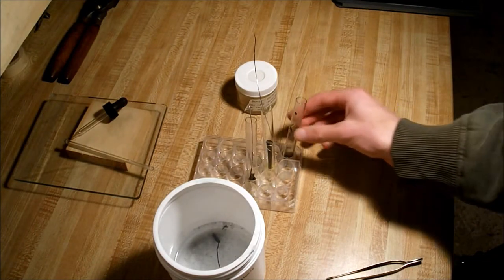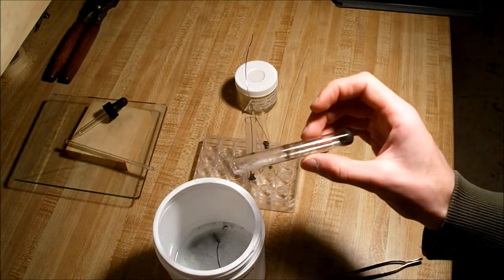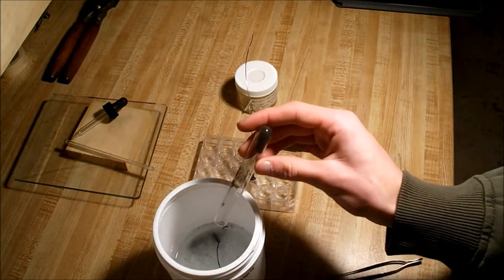You always want to wear safety glasses, and basically, you pour your solutions into there, and as you're going to see, not all of our acid is completely out of there.